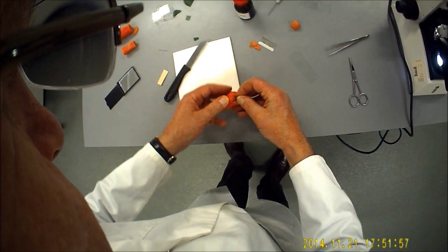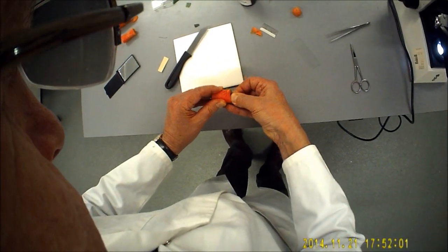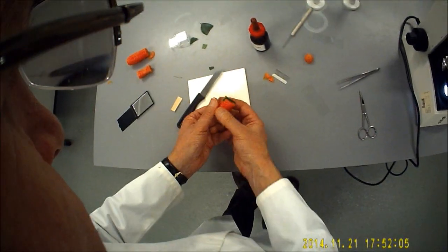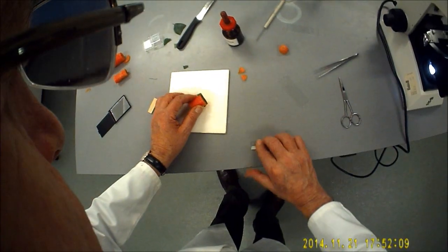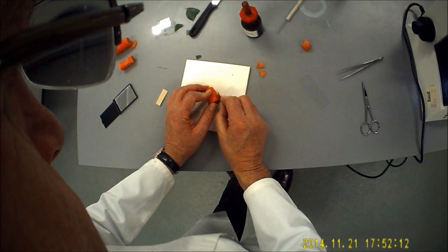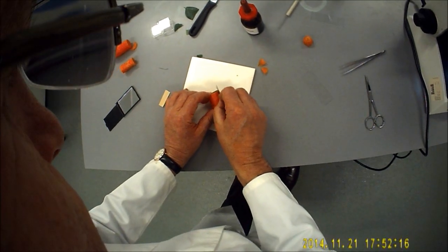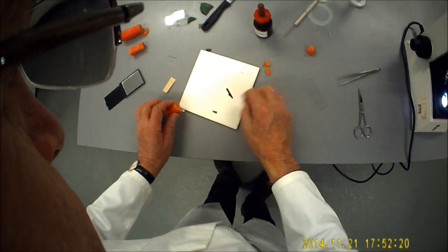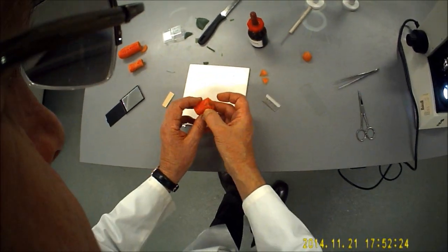That's lovely. I'm going to just take a single-edge razor blade and just trim off the surplus like so, and just take it off level with the surface of the carrot. That carrot is quite thick.